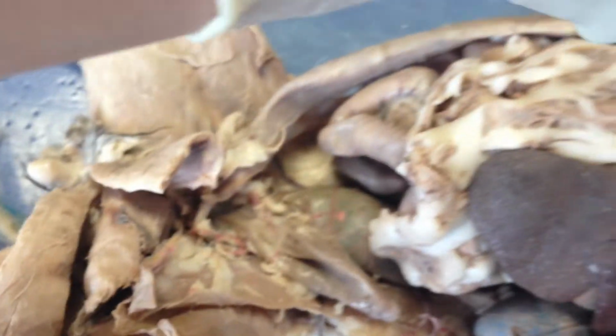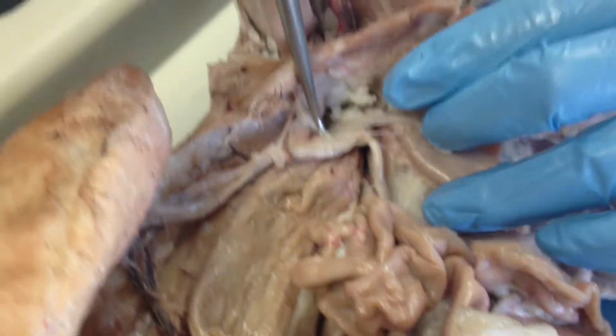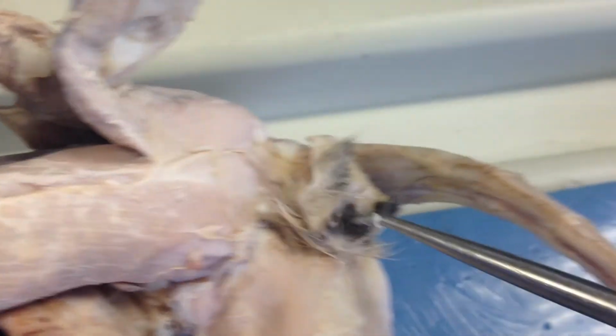And the female parts are, so this is the ovary, right here. It leads down this duct to the horns of the uterus, so that's one horn on this side. And the vagina, we can't see it from the inside, but it's just this hole right there, and we're done.